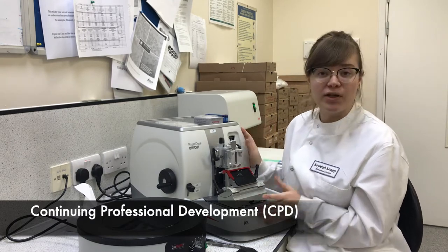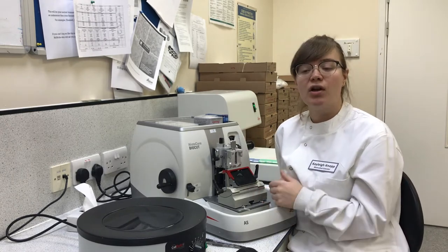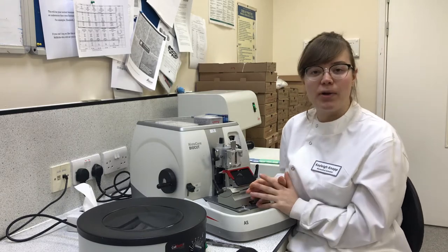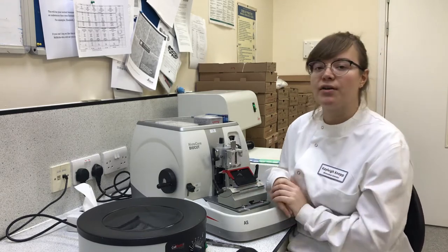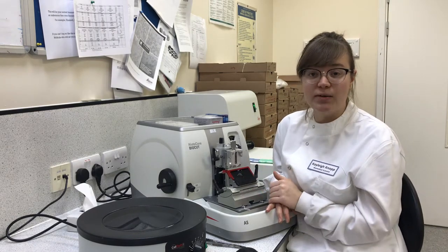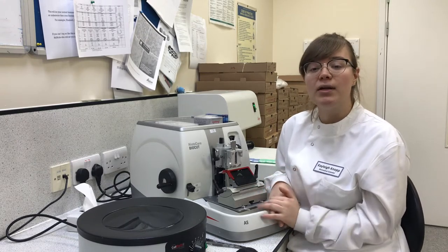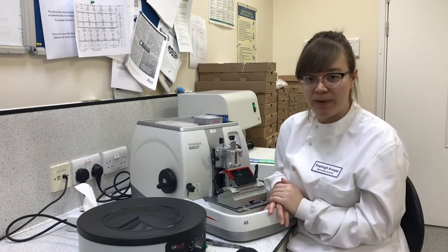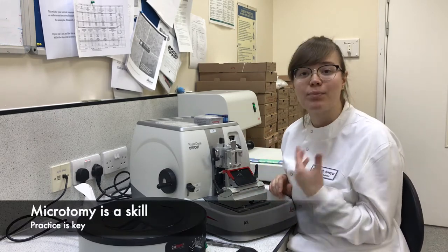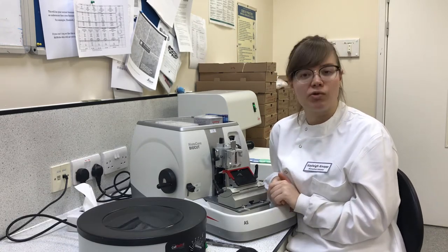The topics I'll be covering today include parts of the microtome, health and safety considerations surrounding microtomy, trimming the block, sectioning the block, and tips and tricks I've picked up along the way. I'll be covering lots of information today — remember you can re-watch, rewind, and review this video at any time. Microtomy is a skill and it will take practice, but watching this video should put you on the right track to becoming a competent microtomist.